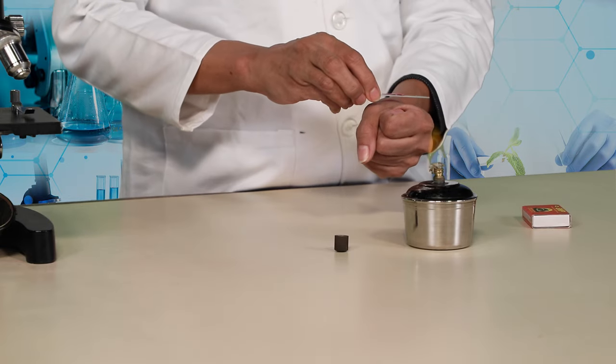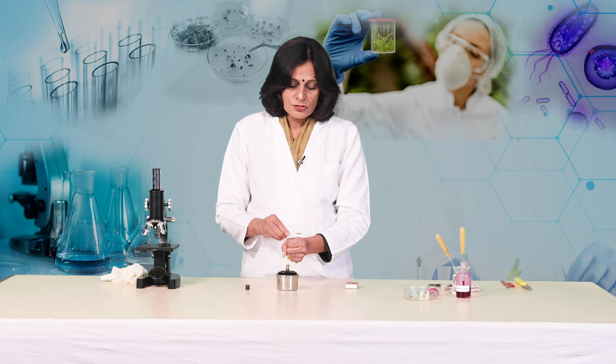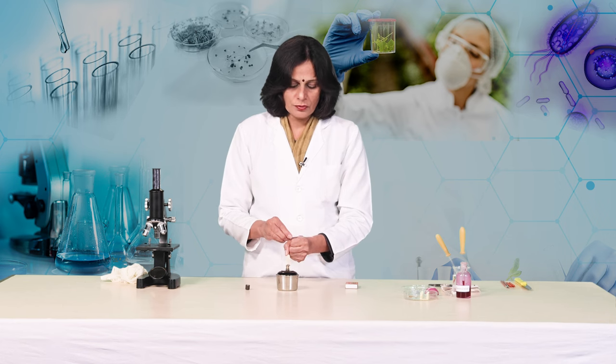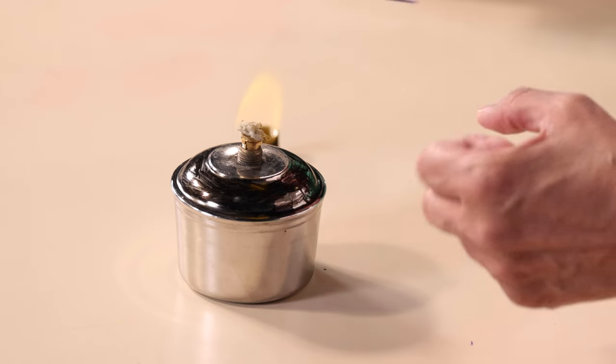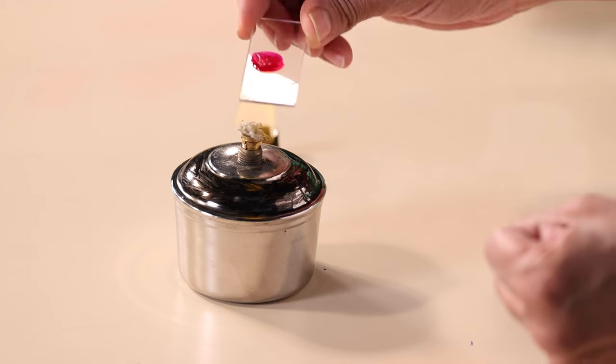What we will do is, in between we are going to touch it here. It should not hurt you. That is why I said that heating should be gentle.